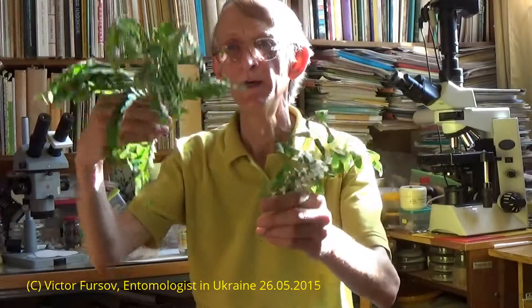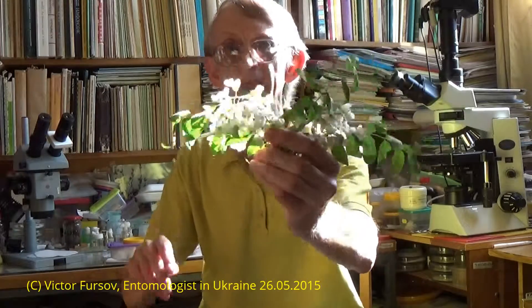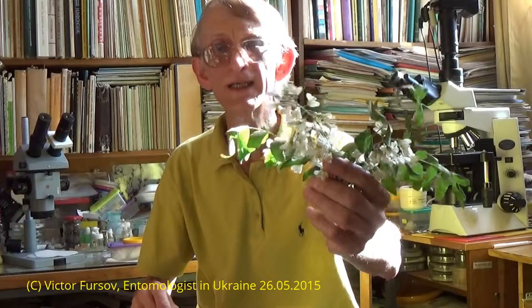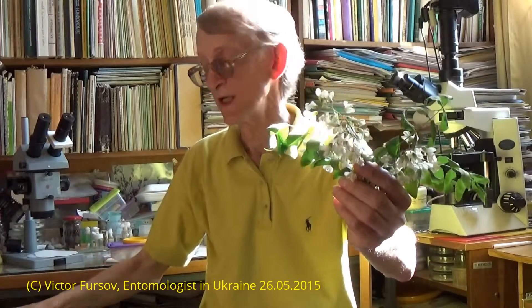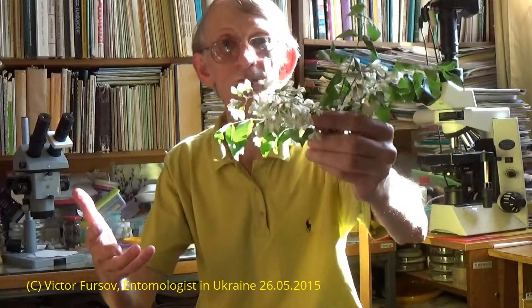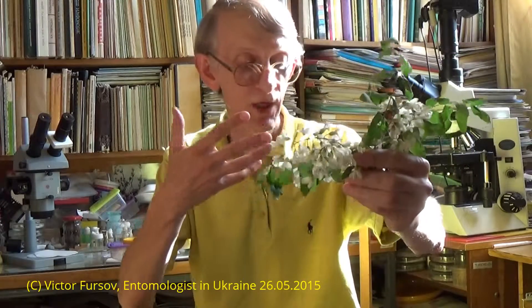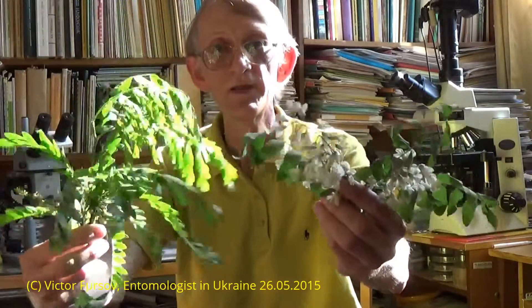And these are 2 different plants and they are very similar — it looks a little bit similar, because the leaves are looking similar. One is White Acacia or Pseudoacacia, very common and very important for nectar collecting and honey producing by your honey bees. You see, these white flowers are very common, very well-known, the scientific Latin name Robinia Pseudoacacia, and the second plant is this one.